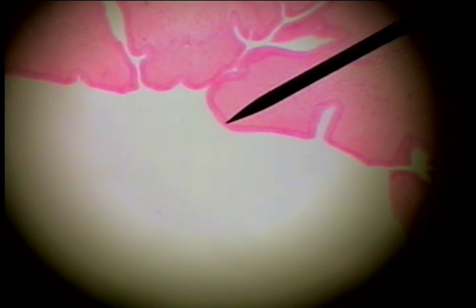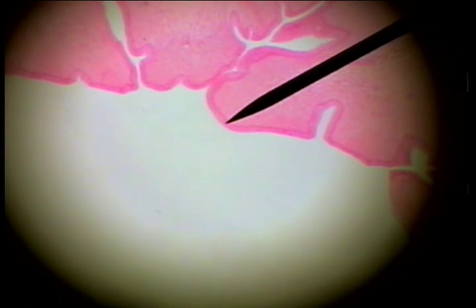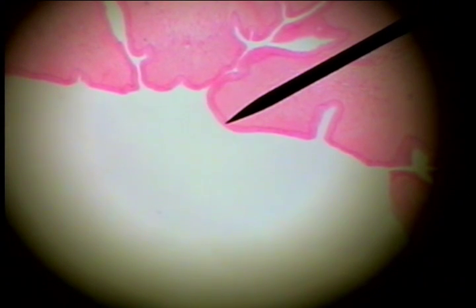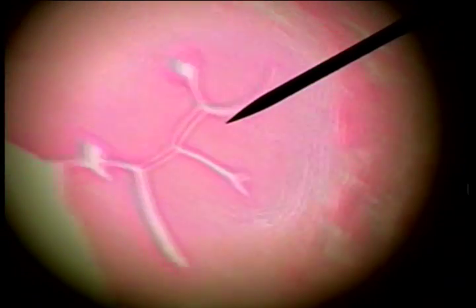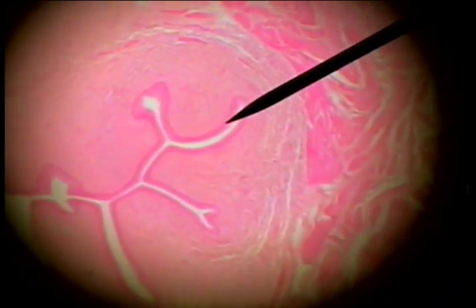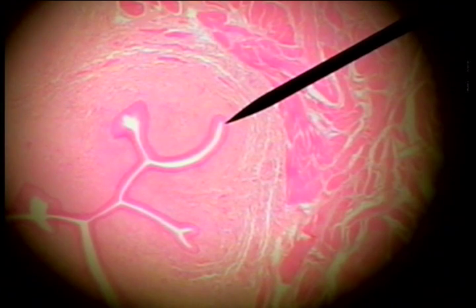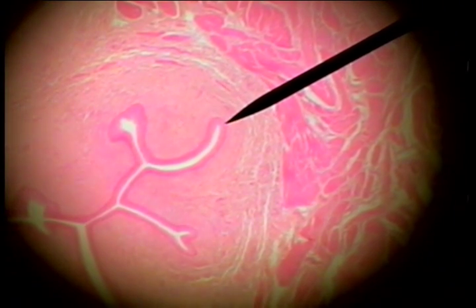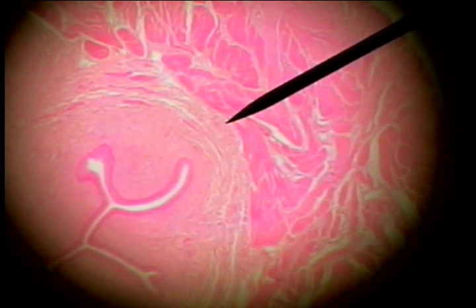The urinary bladder is a reservoir for the urine brought to it by the ureter from the kidney. Here's the lumen or internal surface. You can see that this inner surface of the bladder is highly folded, and down at the bottom of one of these folds we can see the epithelium. This is transitional epithelium. This is the lamina propria, which is connective tissue of the mucosa.